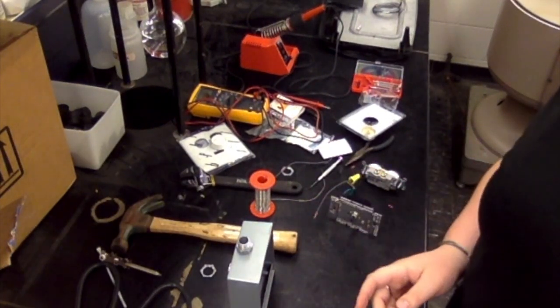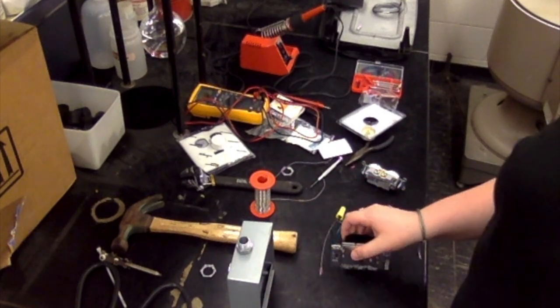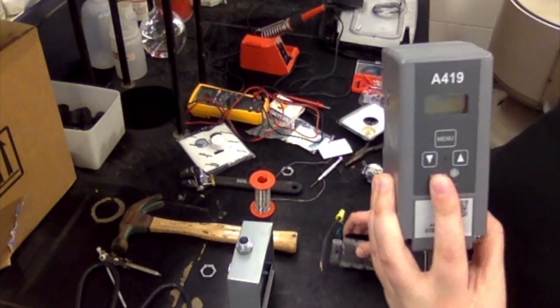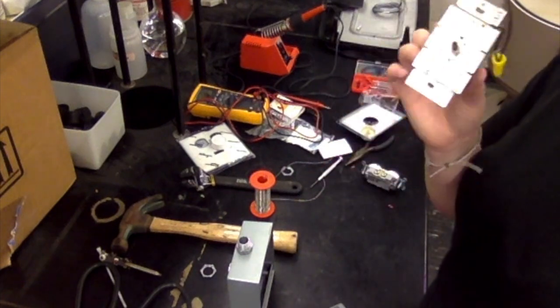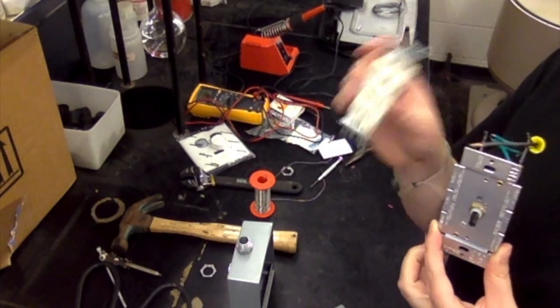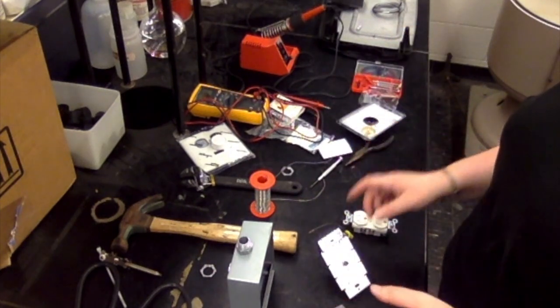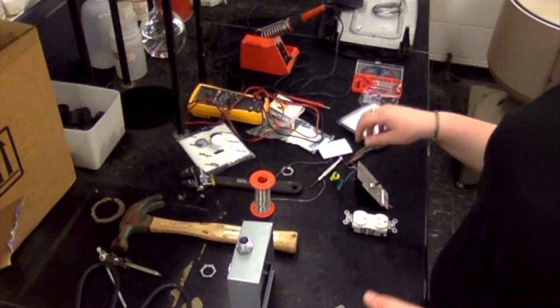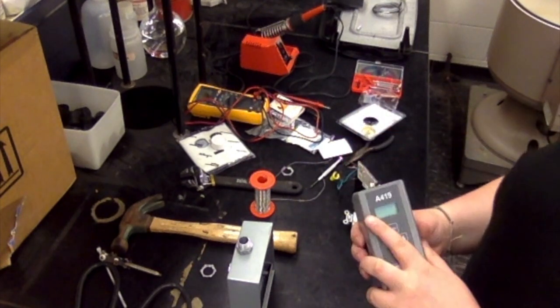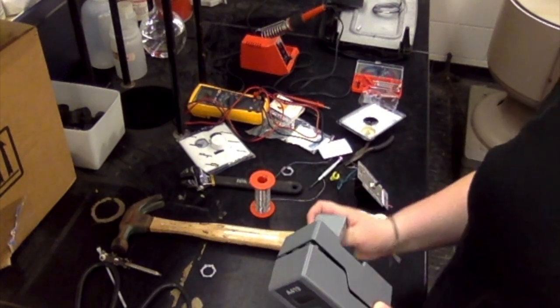Okay, so the next thing that we need to do to complete the modification is to basically wire all this stuff together. So you're going to have your A419, you're going to have the dimmer switch, and then you're also going to have the 2-gang outlet. The easiest thing to start with, in my opinion, is the A419, and to get this mounted onto the box that we're going to be assembling all this stuff in.